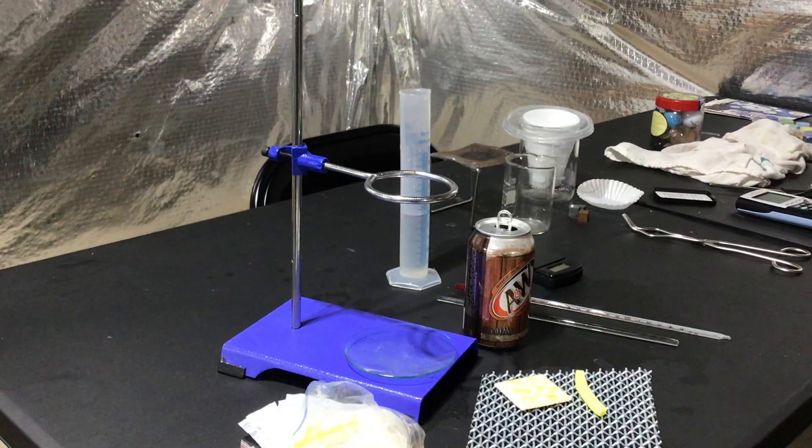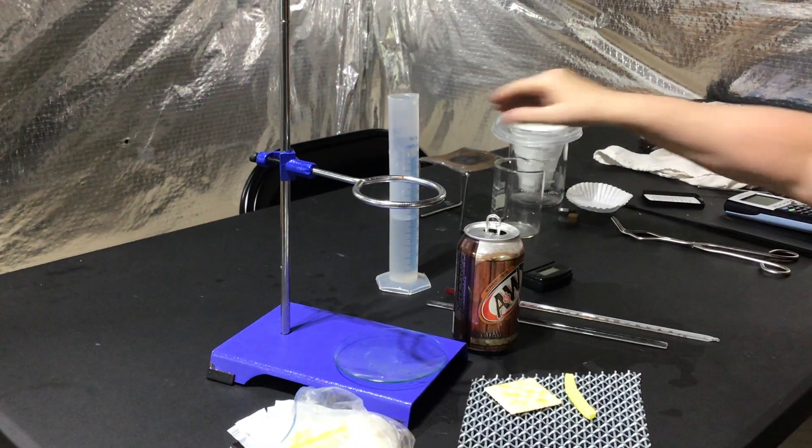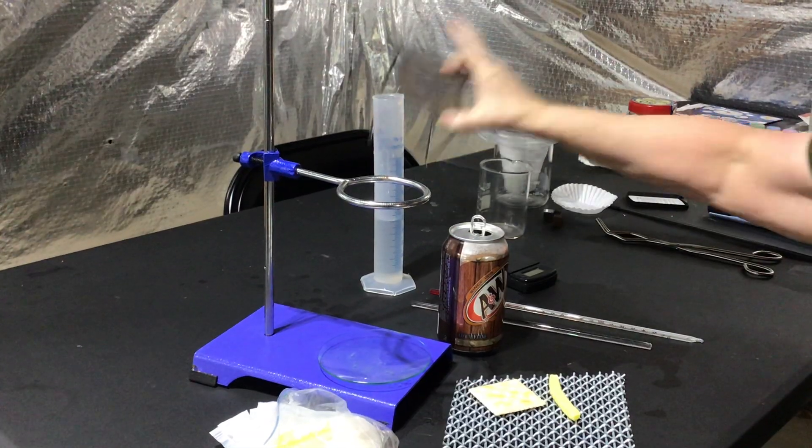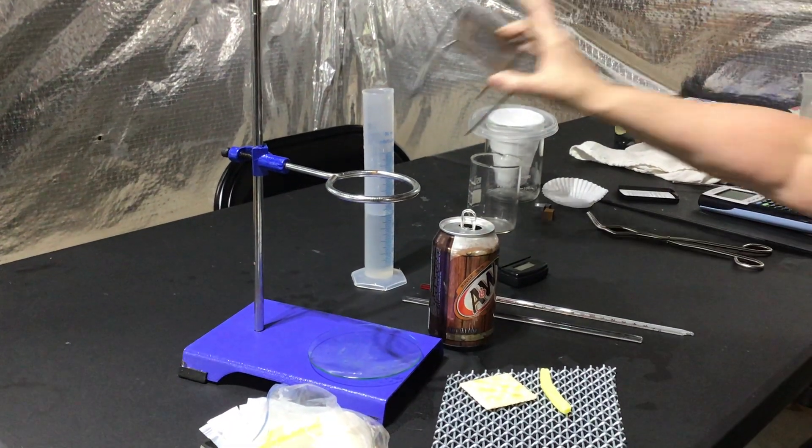I've done this enough times that you want a nice surface. If you have something more like gauze that you can put it on, yes, there's going to be heat transfer. It's still going to be easier.